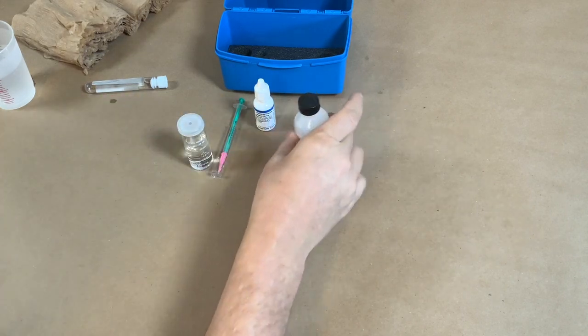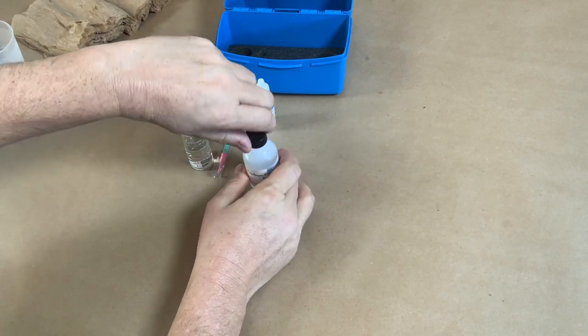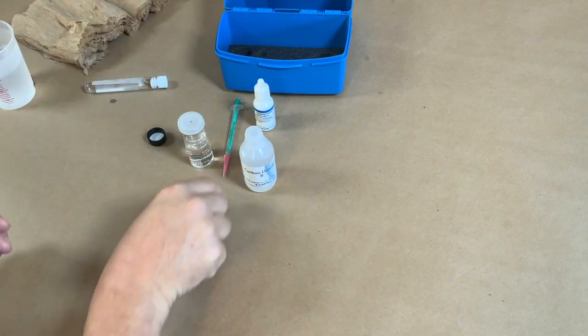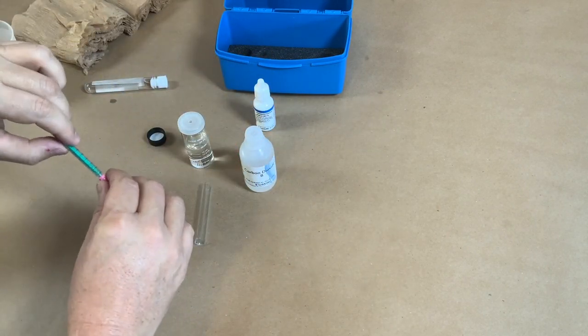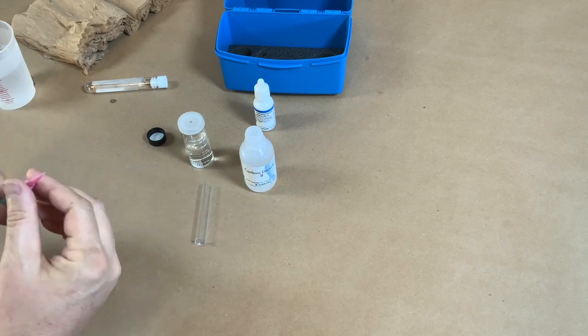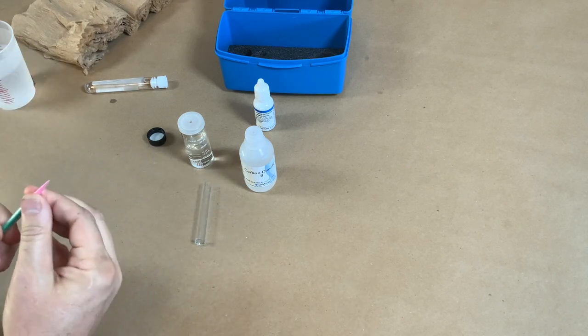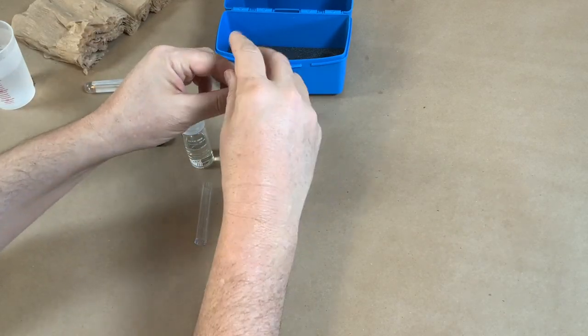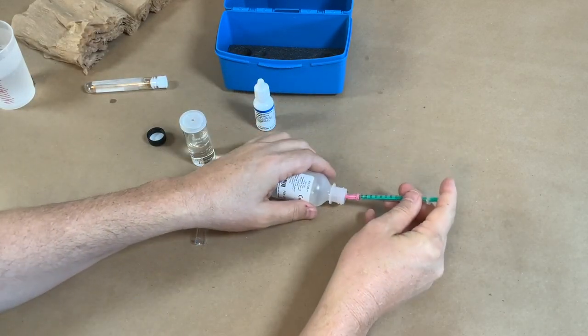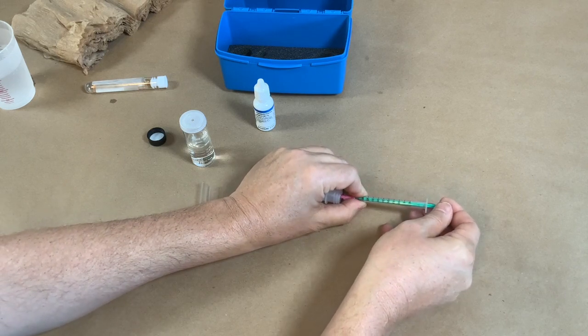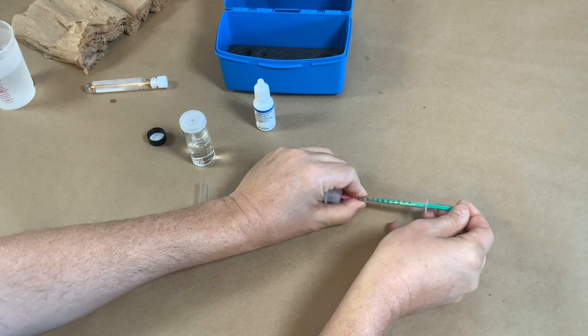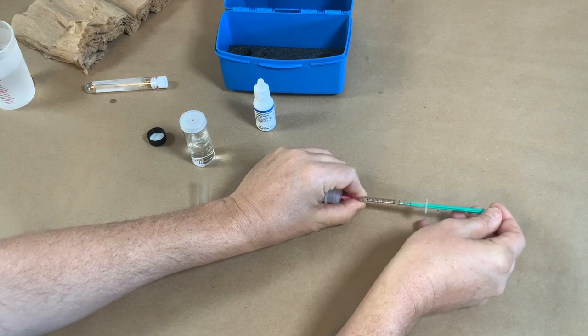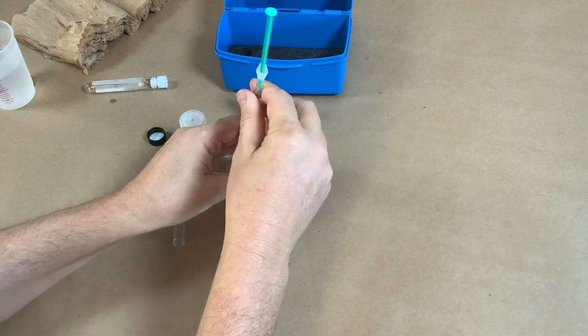Again being careful, we are going to put our syringe into it. So there we go, into it, and then turn it sideways so we get some reagent. I'm going to fill this all the way, so I'm going to pull this open all the way to the zero mark. There we go, so now my syringe is full of carbon dioxide B.